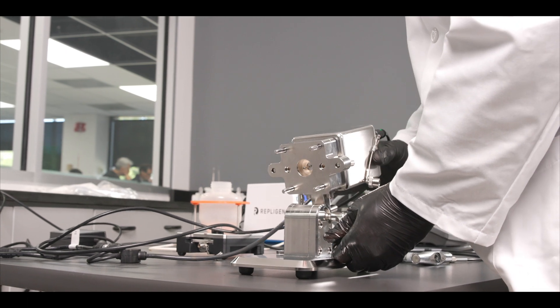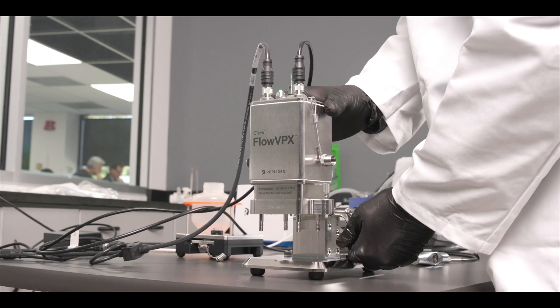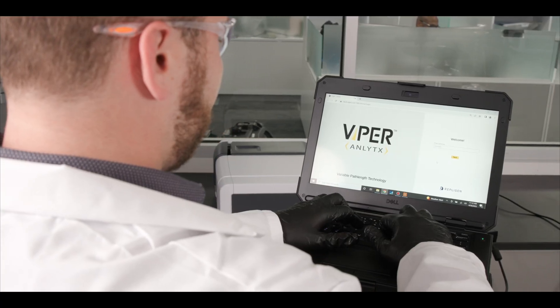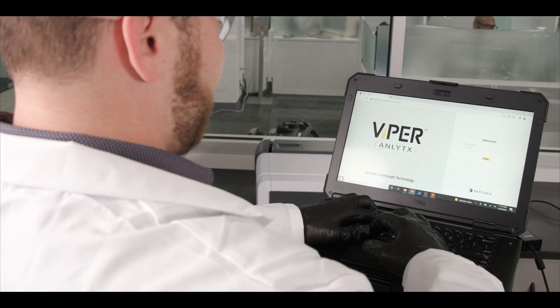We are happy to work with customizing your instrument to your process, so let us know and we'll connect you to a specialist. In this video we will go over how to properly load and unload the flow cell from your FlowVPX system.